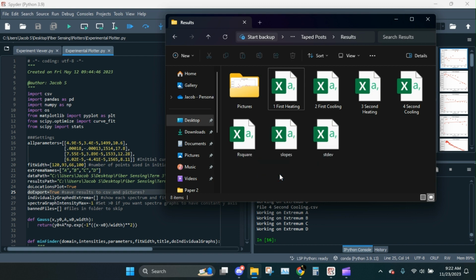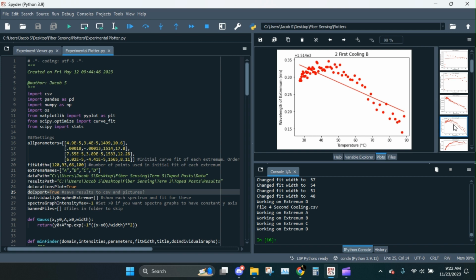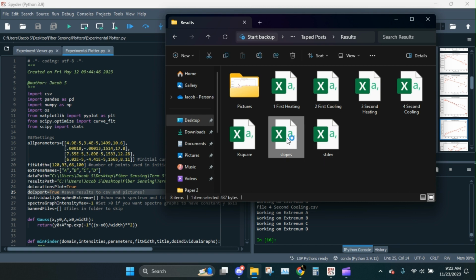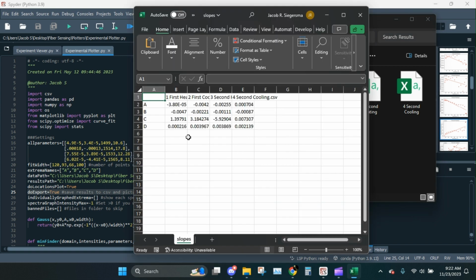And then these three are the slopes, the standard deviation of the slopes, and then the R-square value for all of these line fits that we're doing. Okay? So let's look at the slopes, for instance. Wow. Like first heating D had a slope of 0.000216 nanometers per Kelvin. And then 0.003, 0.003, 0.002, 13, -50. Yeah, C, we all knew C was kind of whack to begin with, so I'm not too worried about C. Here they're all negative. Here they're all negative. Oh, no, that's a positive. That's not fun.